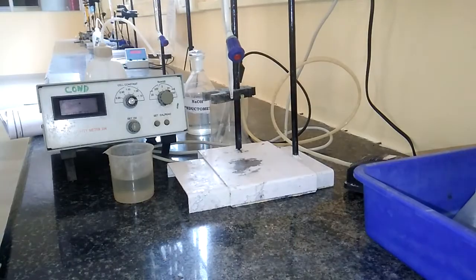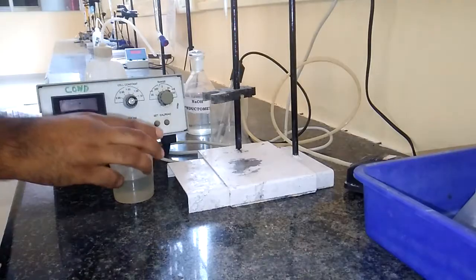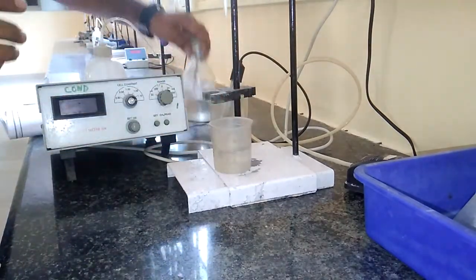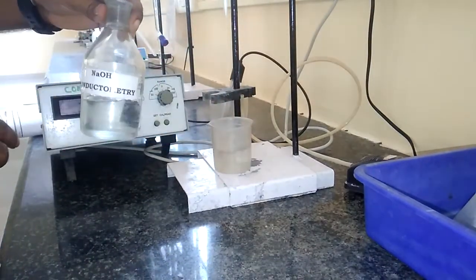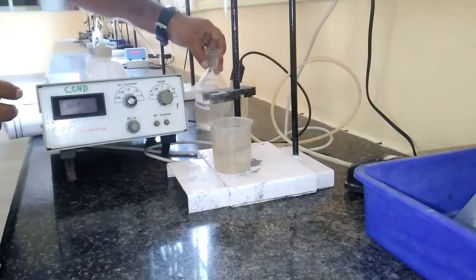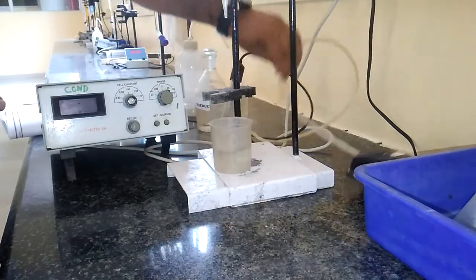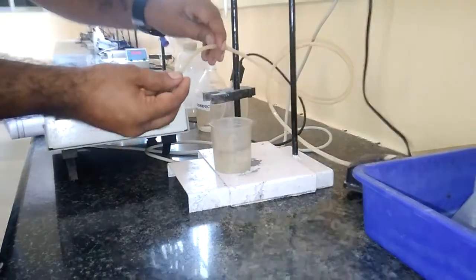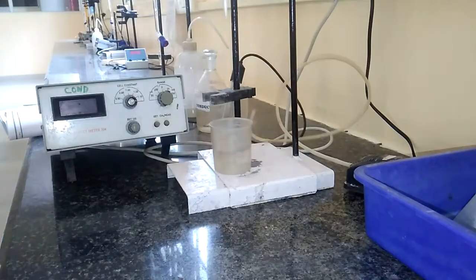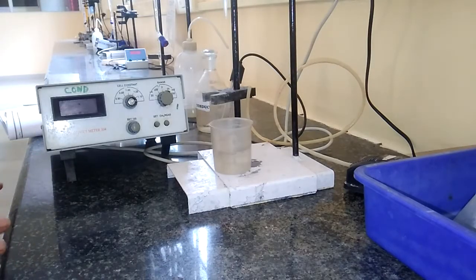We need to take the standard solution of sodium hydroxide. This is a beaker containing the acid mixture. This is the beaker containing the sodium hydroxide — conductometric sodium hydroxide. This is a wash bottle. This is the small rubber tube which serves as the stirrer and mixer. These are the chemicals and equipments we require.